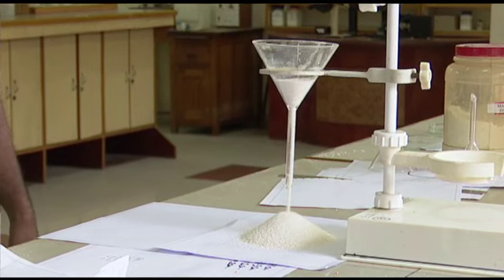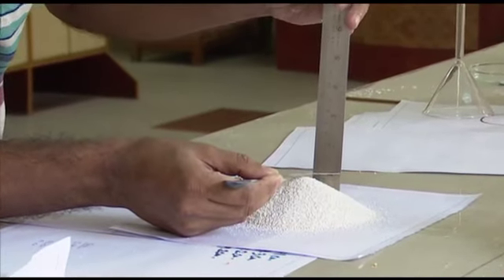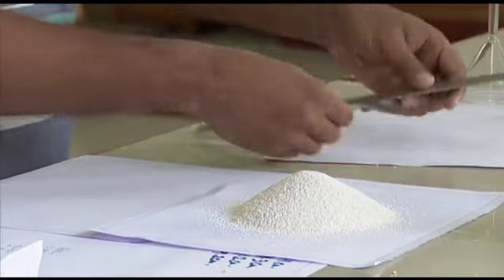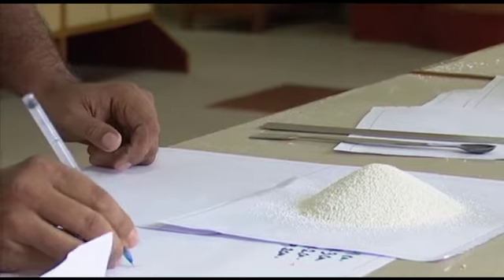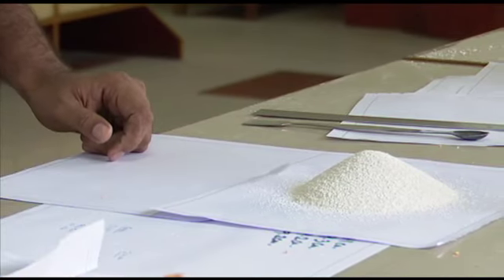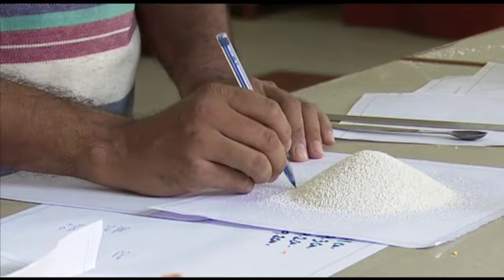So you see, compared to the earlier one, this one looks big, but when we calculate the ratio of the height and width, we are expecting the same value as we got the first time. The height has increased. Initially it was 2.1, now the height has gone up, it's 2.4.